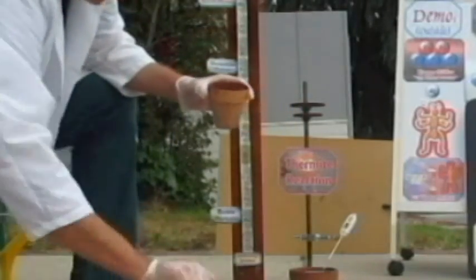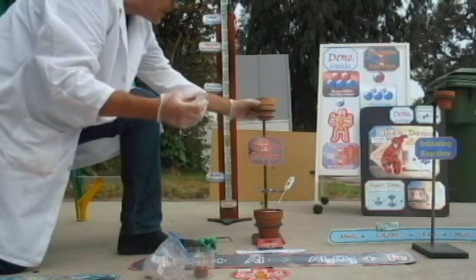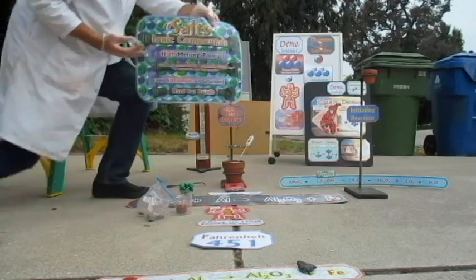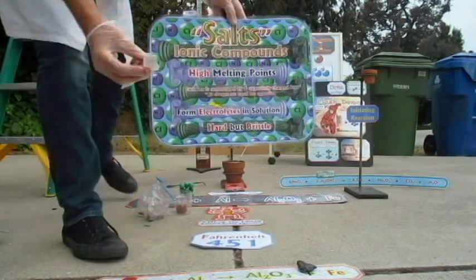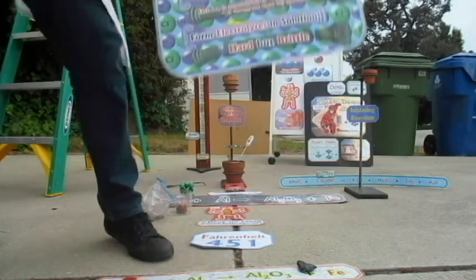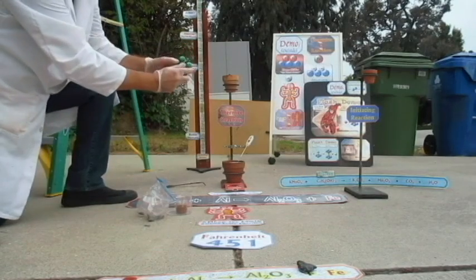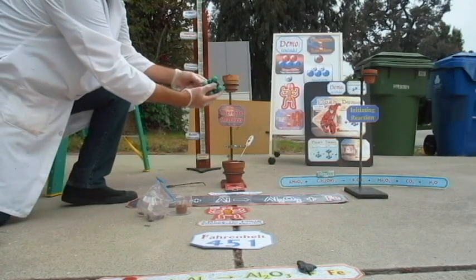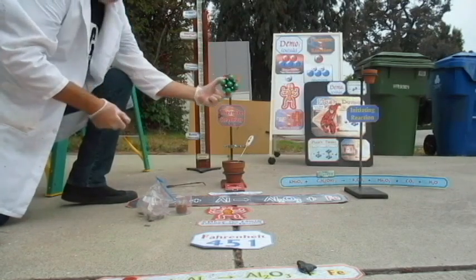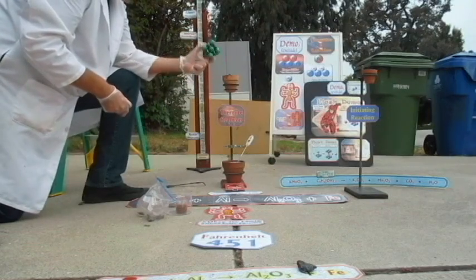We're going to do a few neat tricks in here. One of them is we're going to try to melt an ionic compound. Remember, ionic compounds or salts are very hard to melt. Here's one, this little cube here. It's very hard to melt because of the ionic compound structure, like this. You can shake them a lot, they're really not going anywhere. So you can shake them and shake them. It takes about 800 degrees Celsius to melt these, which is like 1,500 Fahrenheit.